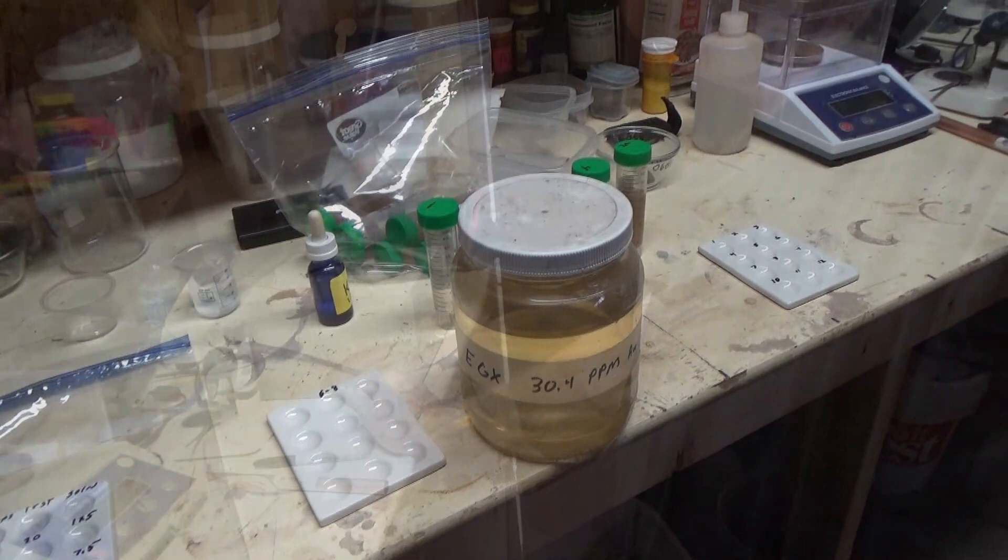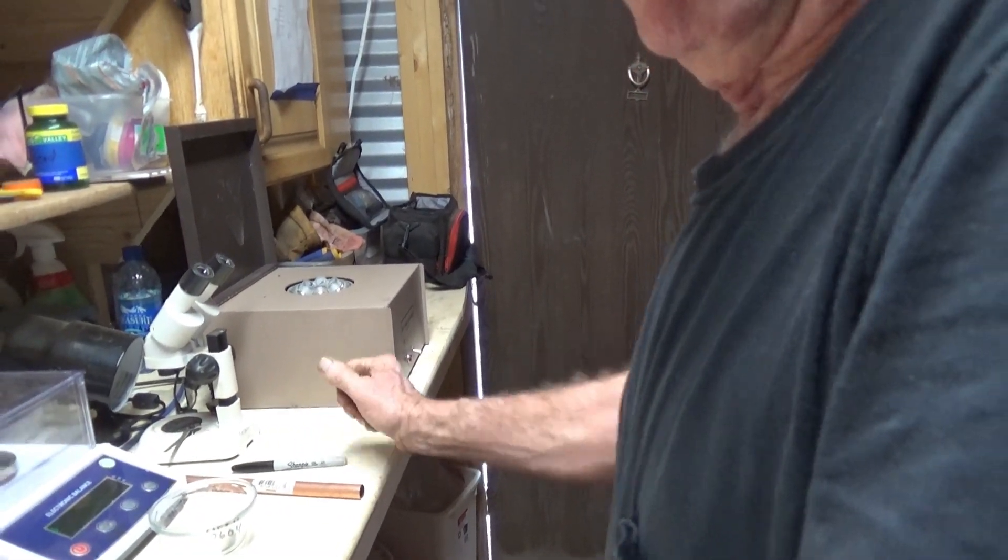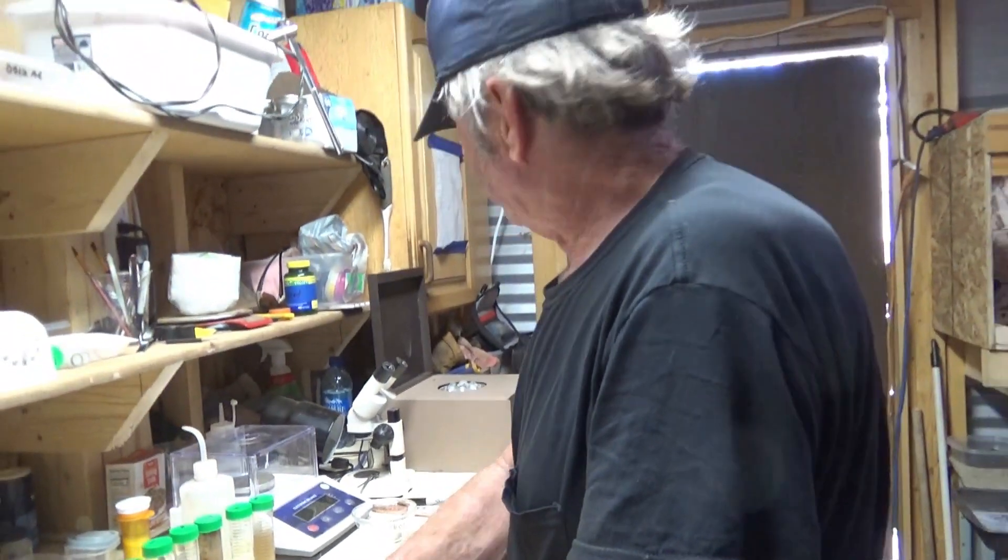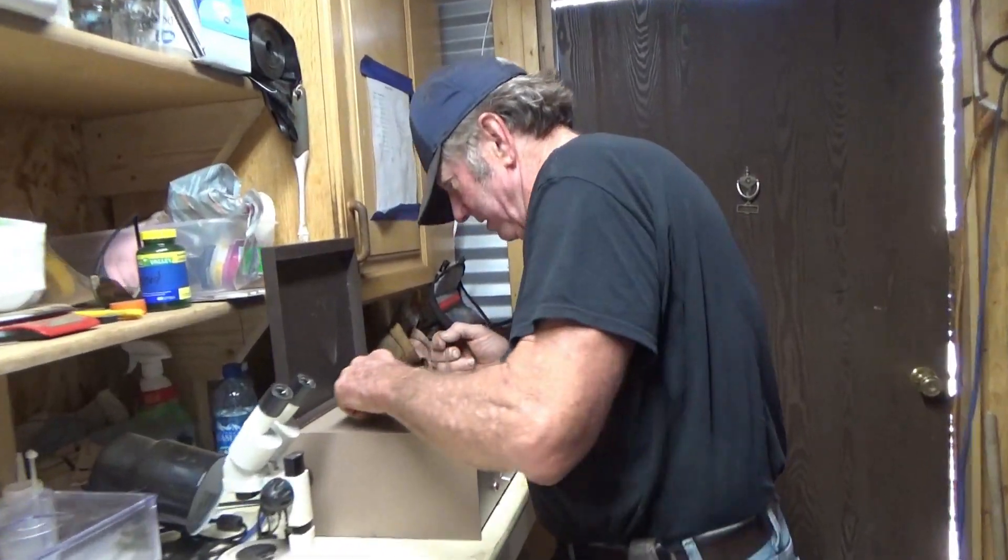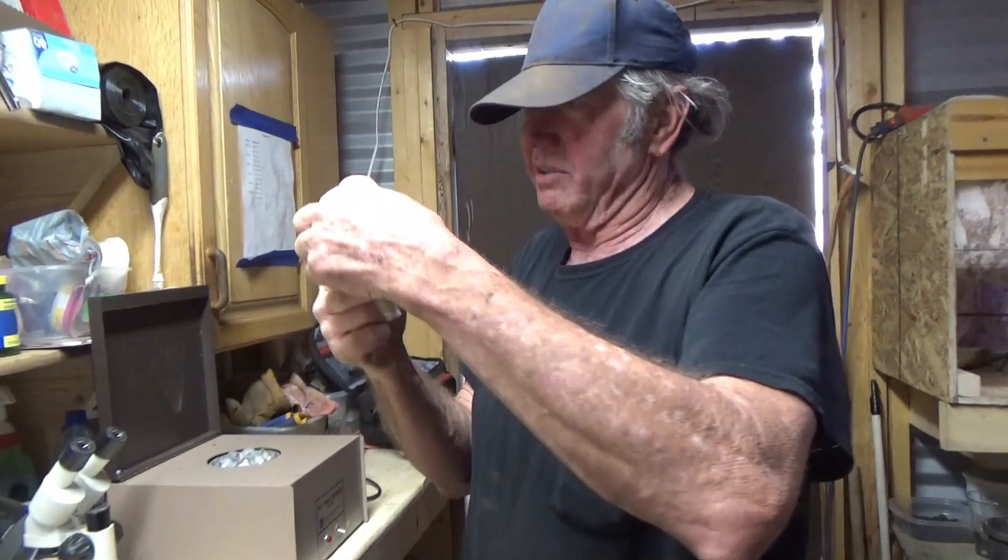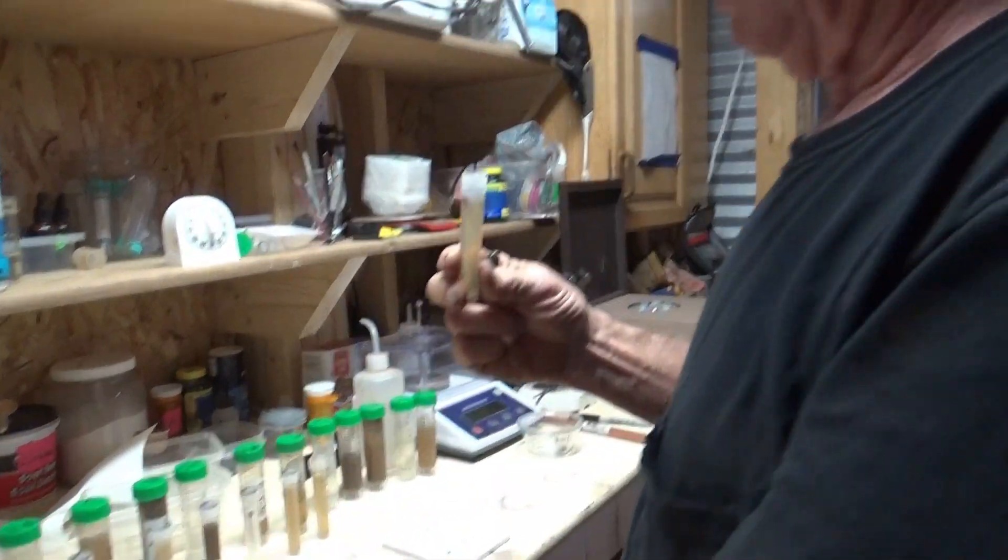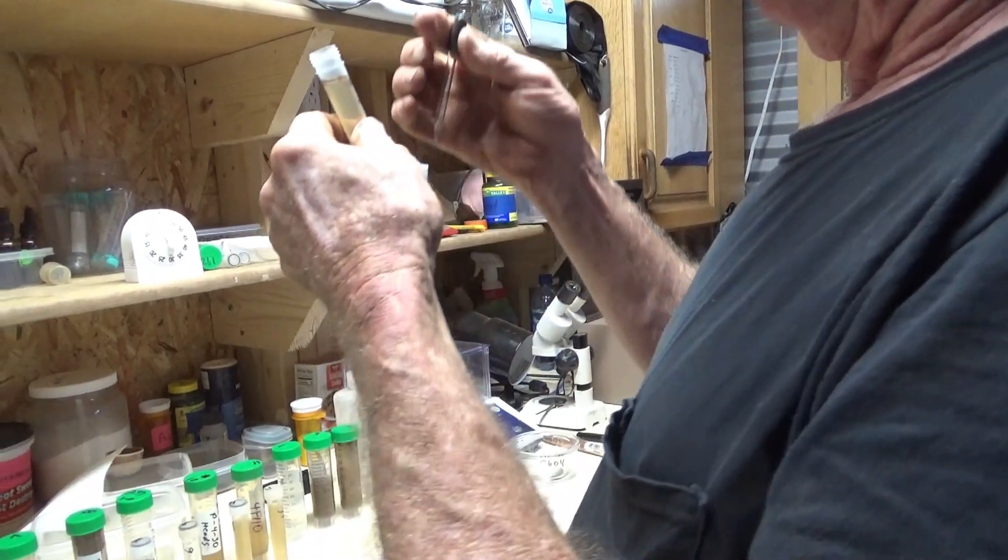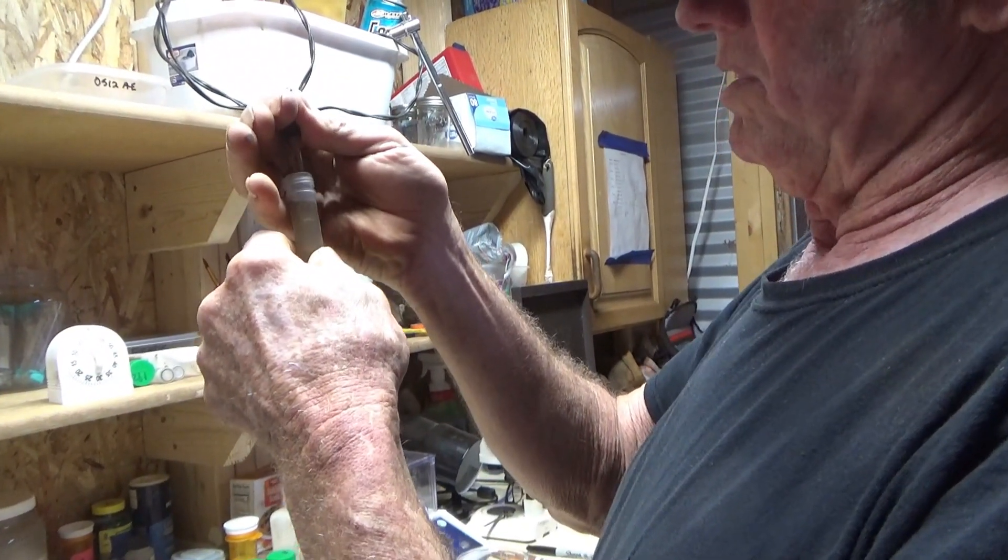We will now see how it works in real life. So the procedure is pretty simple. The reason I put numbers on tops of these is so it was easier for me to figure out which one is which.